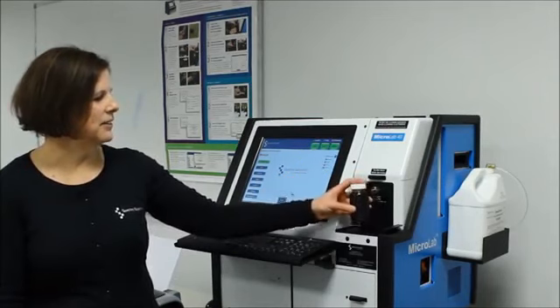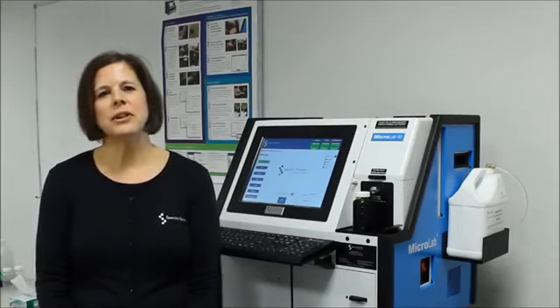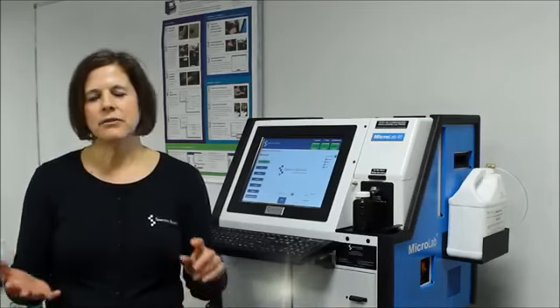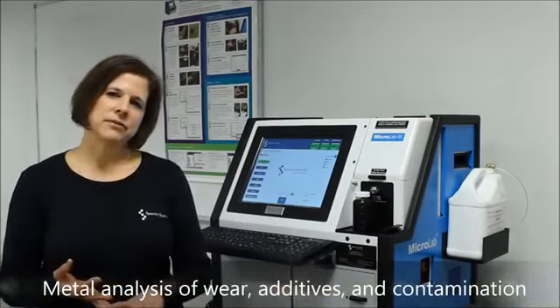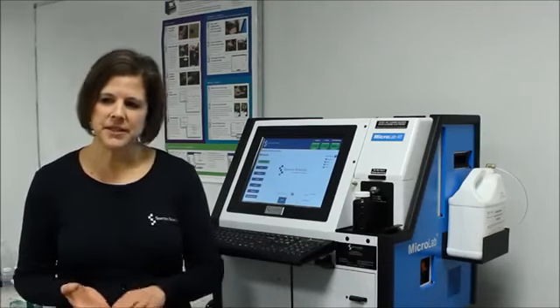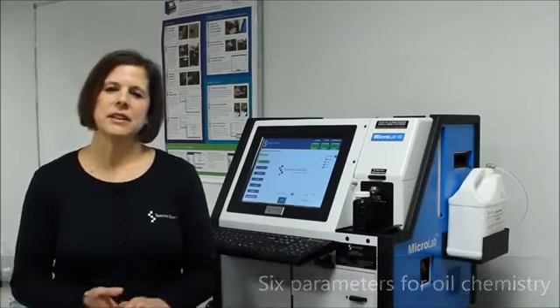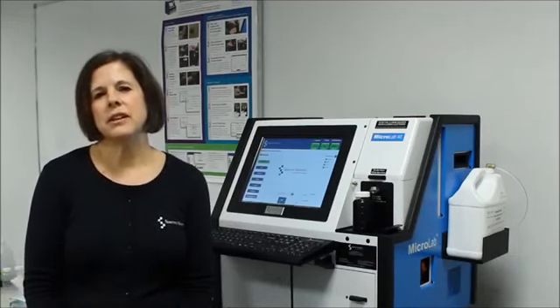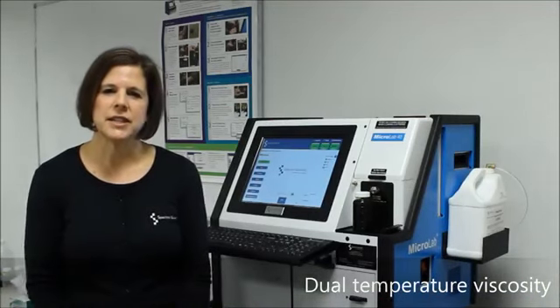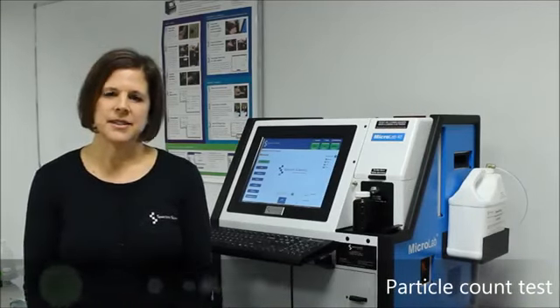With just a 5-ounce bottle of sample, the MicroLab provides all of the parameters that are found on a typical oil analysis report provided from a laboratory. This includes a metal analysis of wear metals, additive levels, and contamination elements of up to 20 different elements. It also includes 6 different parameters for oil chemistry, giving the complete picture of oil health and condition. And viscosity is given at 2 different temperatures, 40 and 100 degrees Celsius. And in the MicroLab 40 version, you also get a particle count test.